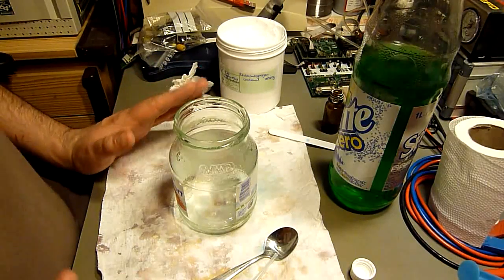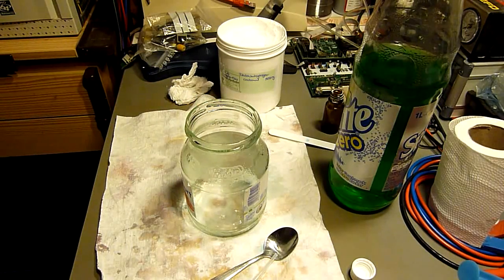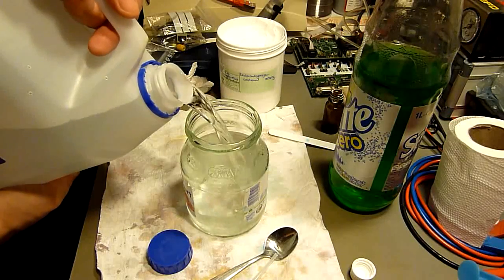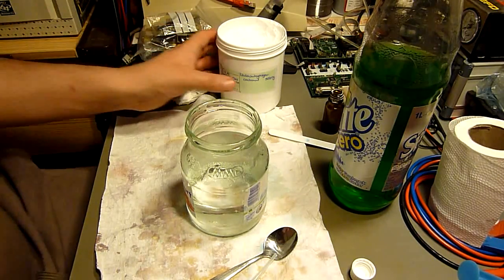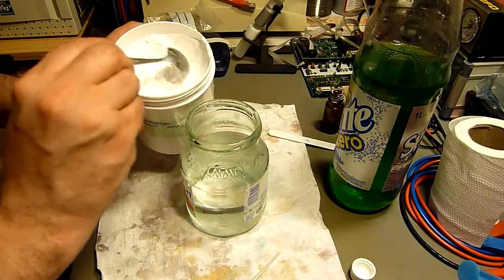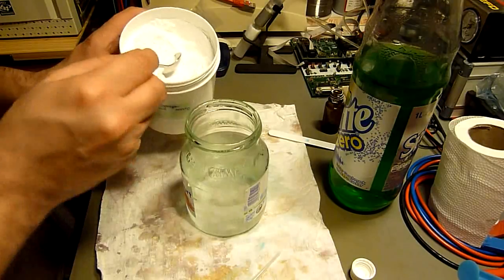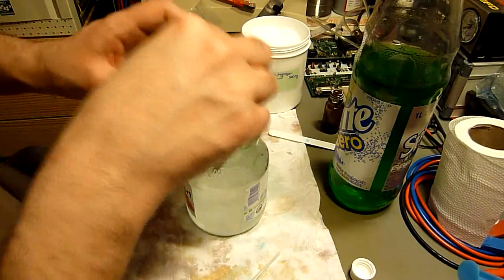One thing about it — be careful. I need a little water. Always be careful when doing this, because the reaction is a little stormy. Exothermal reaction. At first we need some of this chemical here, which is sodium carbonate. This is a very cheap chemical, so not much of a problem here.